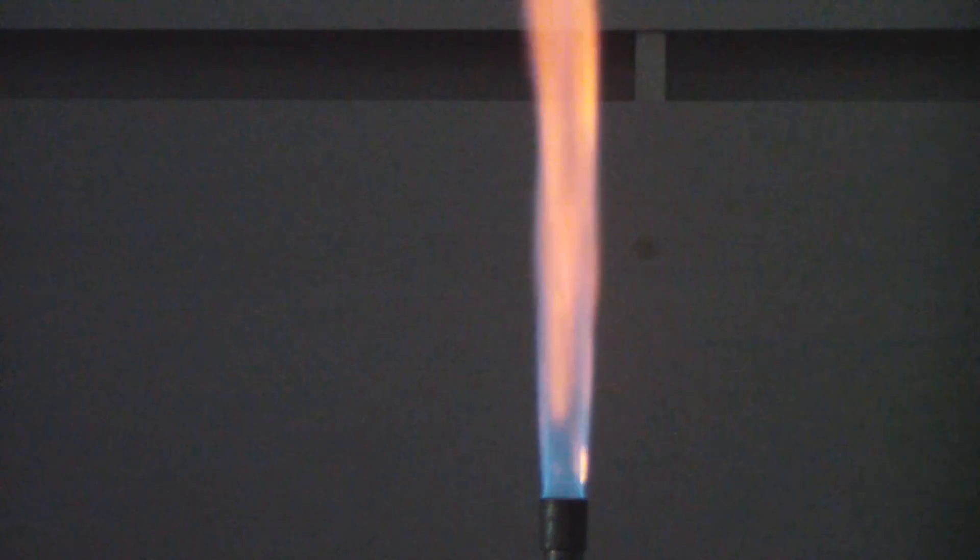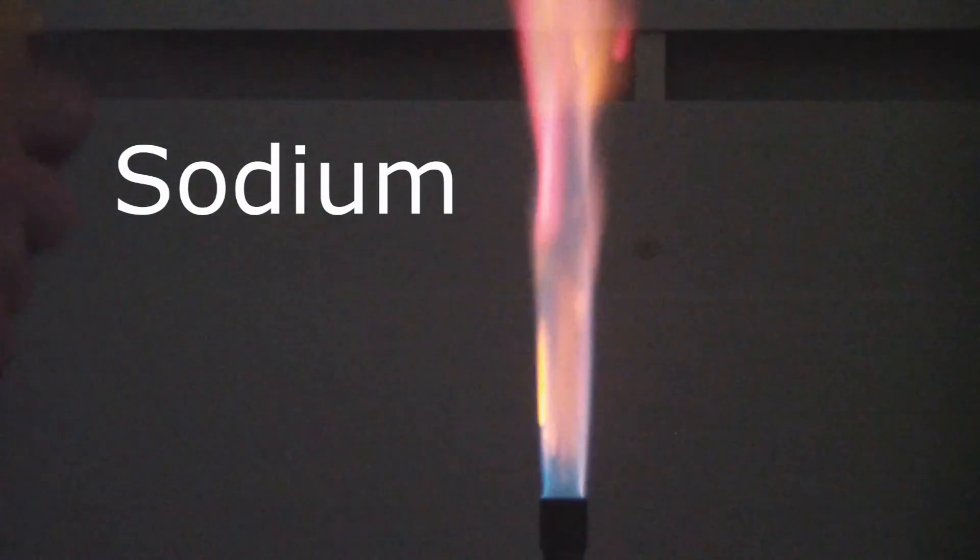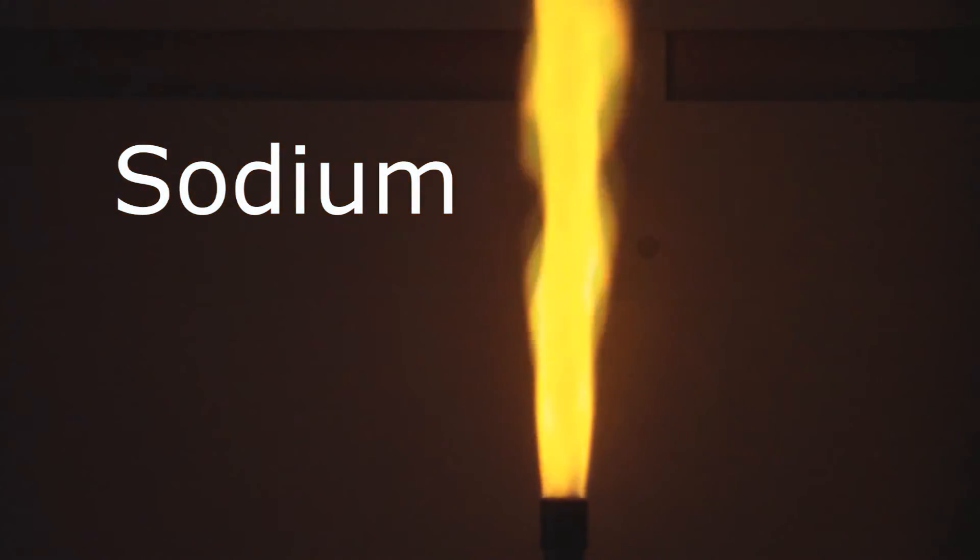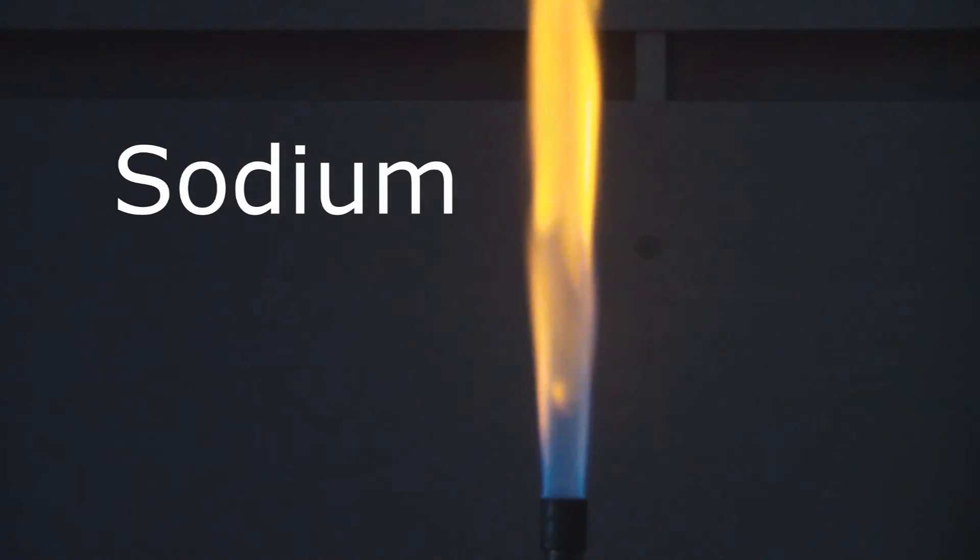Next one is sodium. Now sodium, also orange, but you can see it's also got some nice yellows mixed in with that particular one.